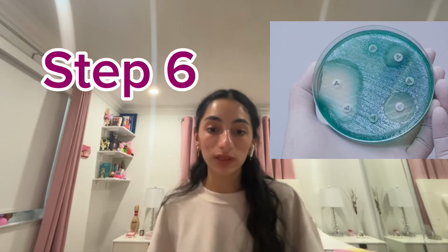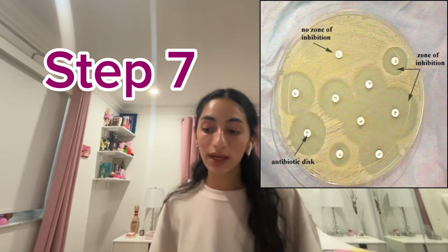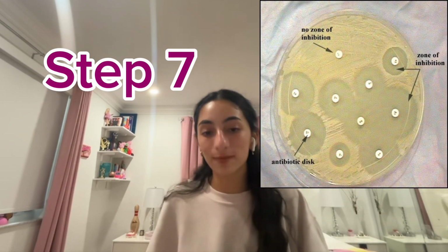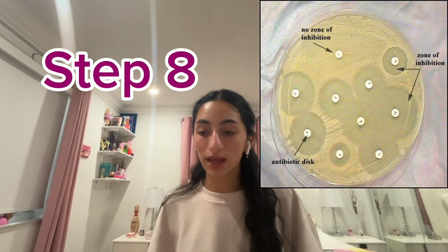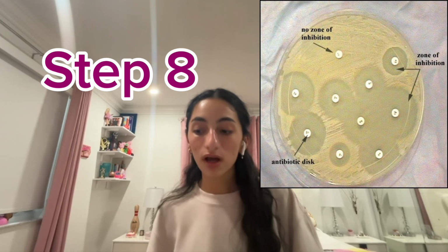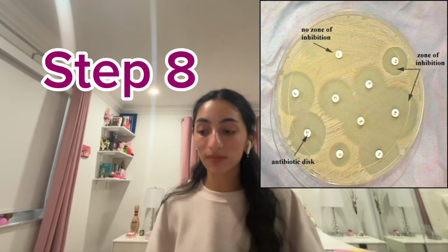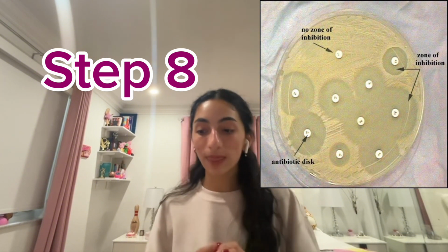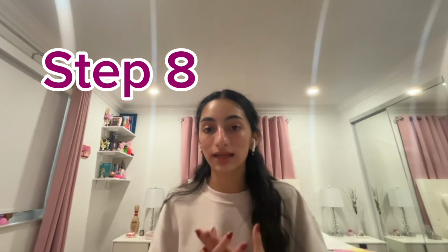You close your plate and you leave it there for, let's say, 1 week or a couple days or even overnight. And then you come back and you check your results and you measure your zone of inhibition. And the zone of inhibition, what this indicates is how sensitive a bacteria was to an antibacterial or an antibiotic. So there is a certain chart we have to follow to determine how antibacterial or not antibacterial the zone of inhibition is, or bacteria is. If the zone of inhibition is less than 6 millimeters, then it is not antibacterial. If it is between 6 and 16 millimeters, then it is slightly antibacterial. And if the zone of inhibition is greater than 16 millimeters, then it is highly antibacterial.